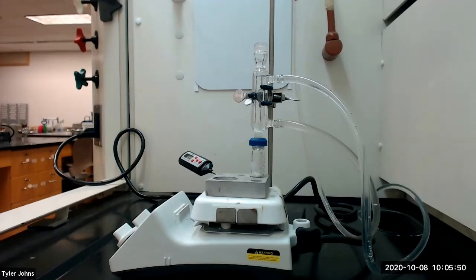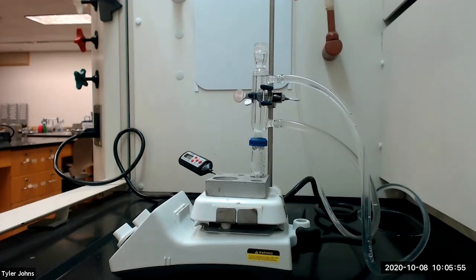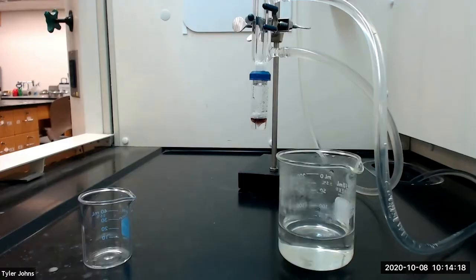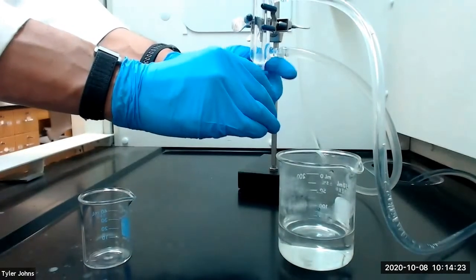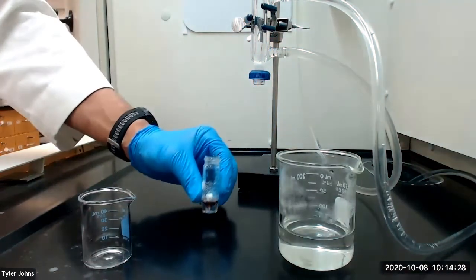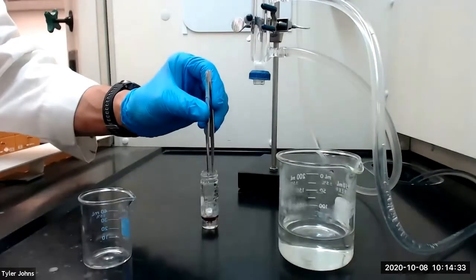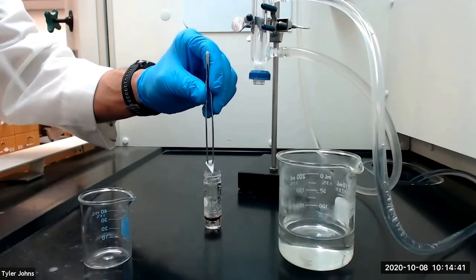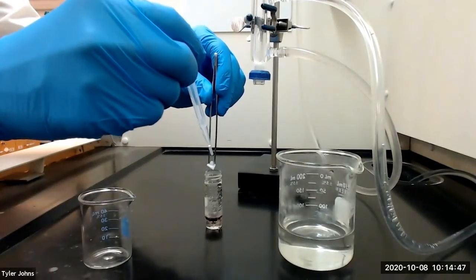Our reaction mixture has now heated for an additional 20 minutes after the solid had dissolved, so we will now remove the vial from the heat. After the vial has cooled to the touch, we're going to detach it from our water-cooled condenser and remove the spin vane with forceps.